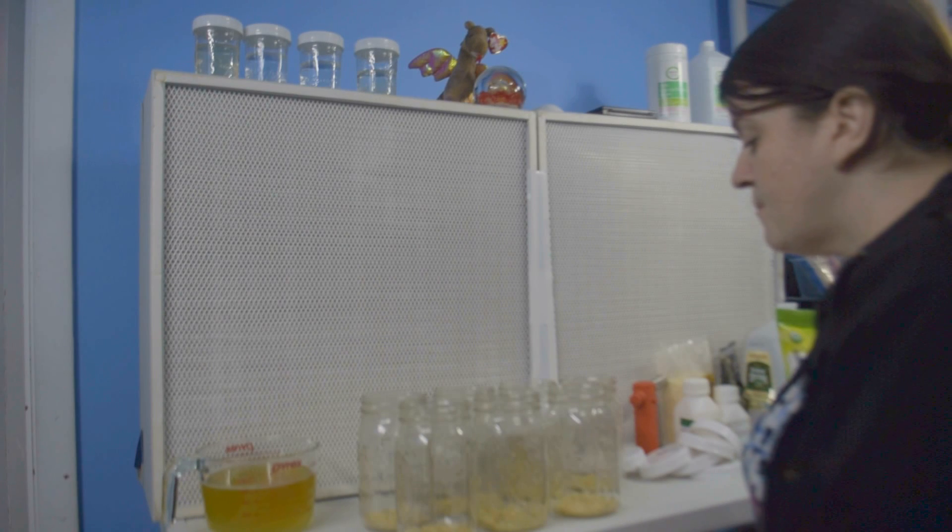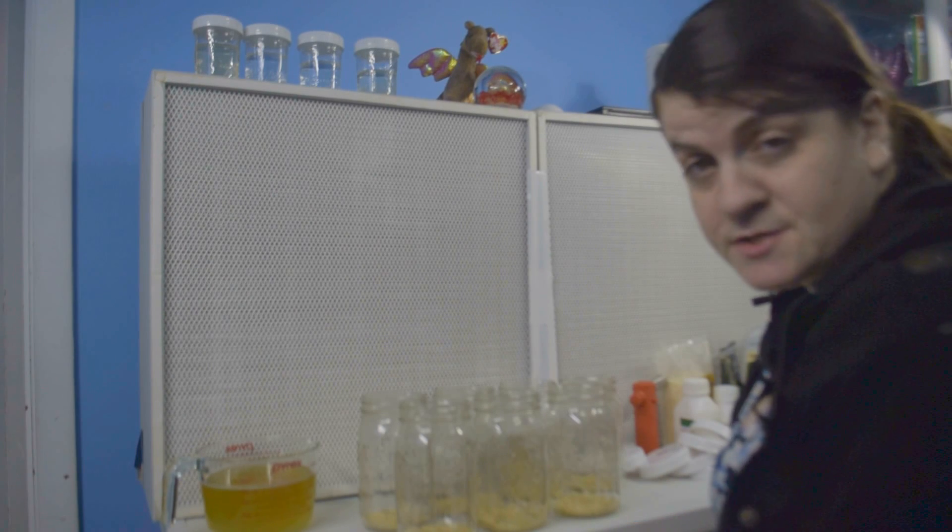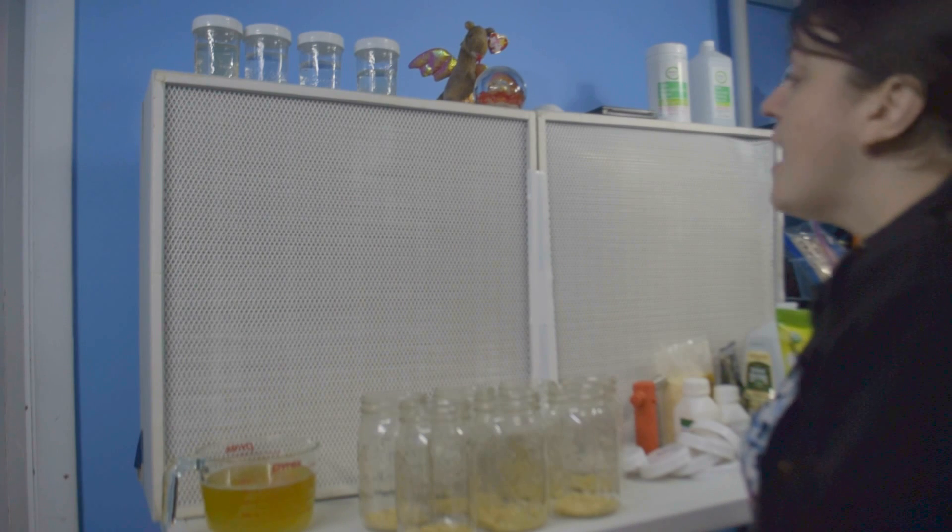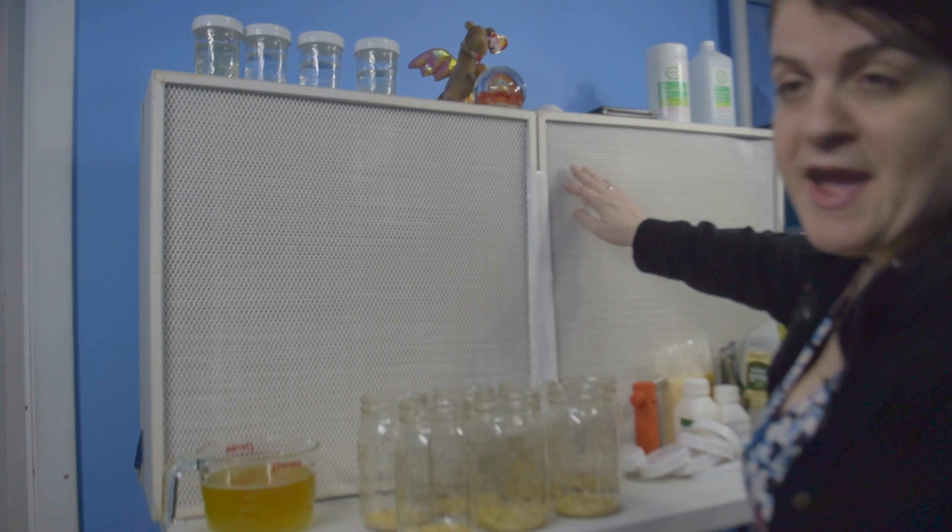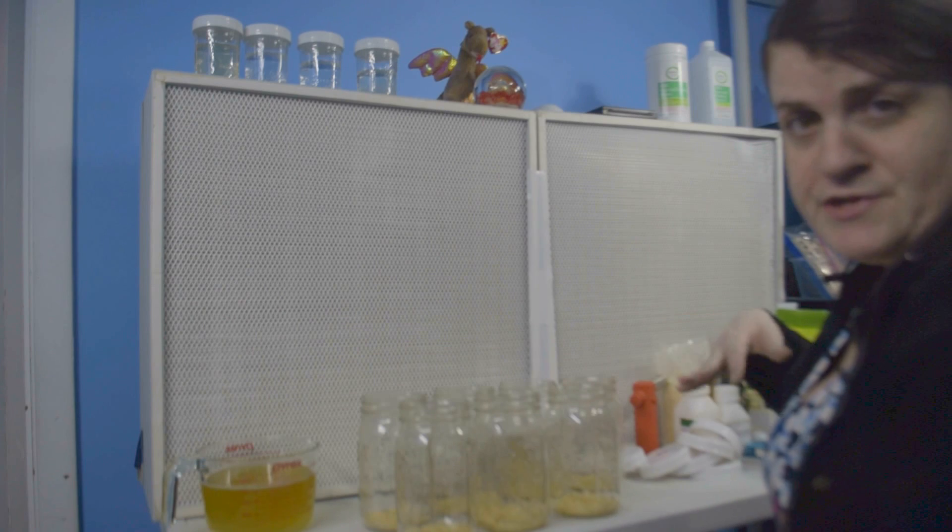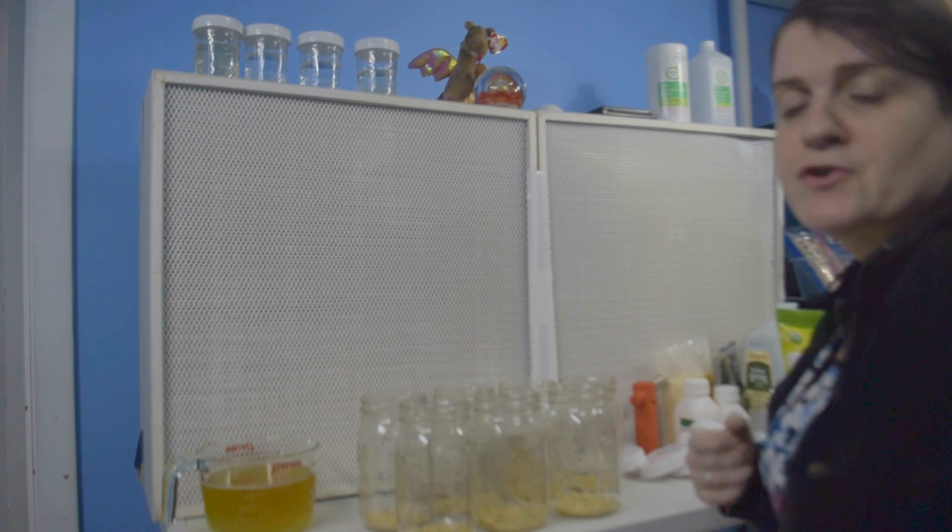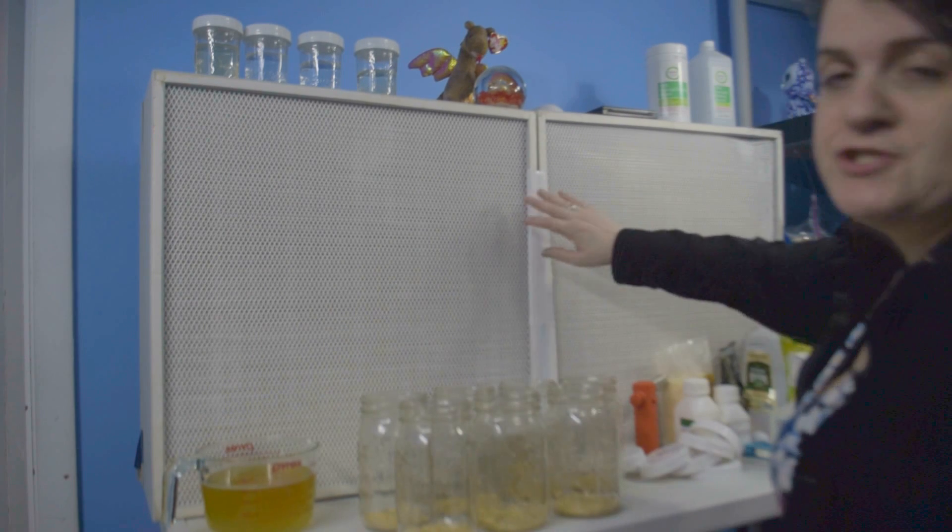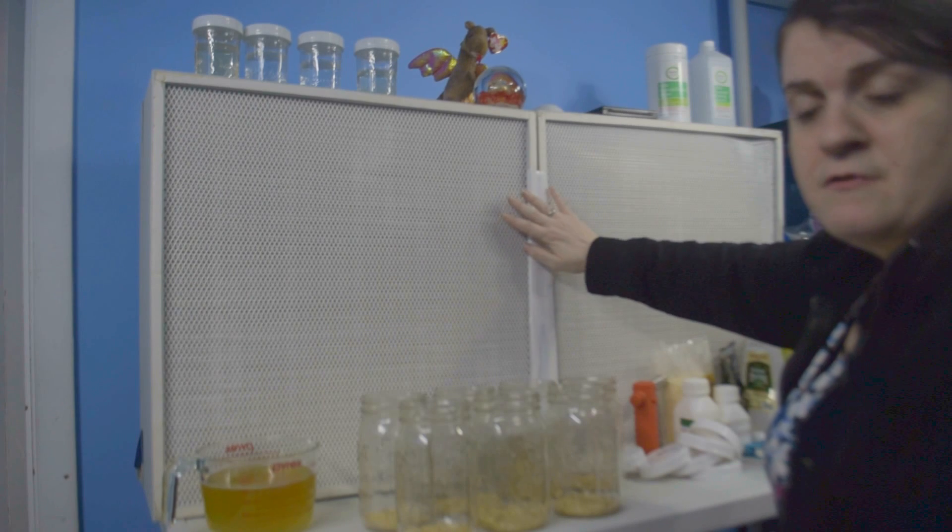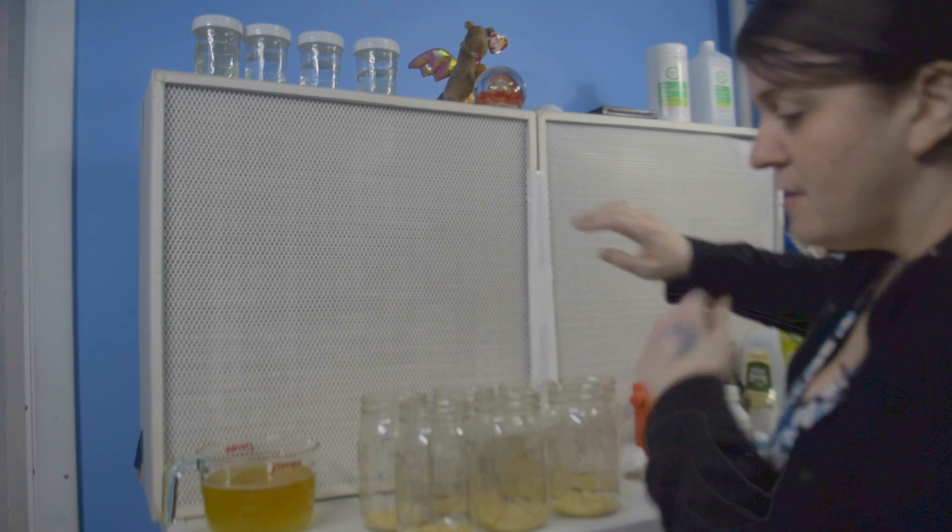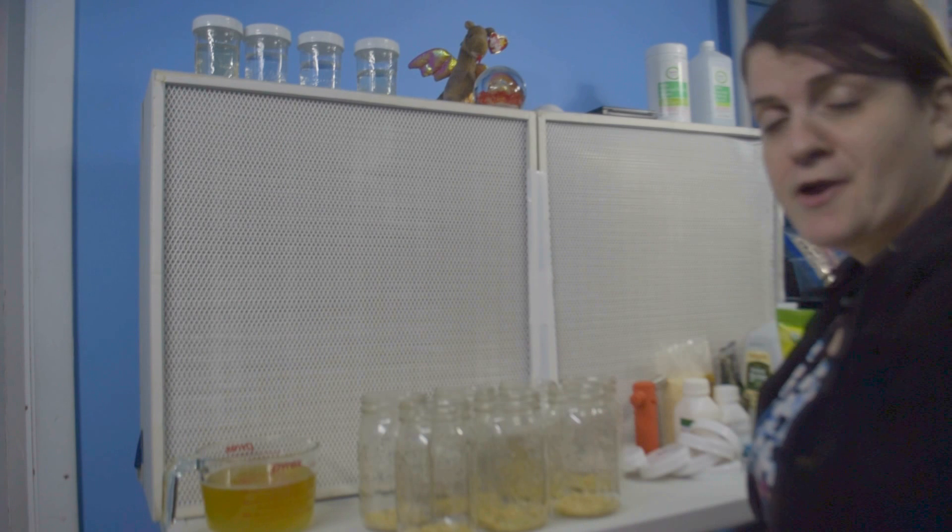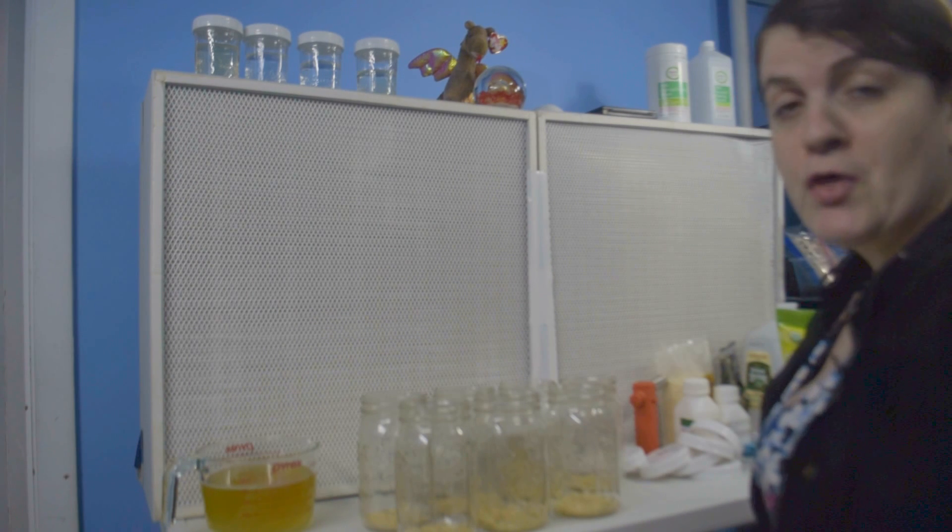So today I'm going to show you my Cordyceps experiment. I have the flow hoods on now. You don't really need the flow hoods on for this part because these are going to go in the pressure cooker, but I have some work to do later so I'm just getting the air in this room nice and filtered. And excuse my appearance, I'm just getting over a cold.